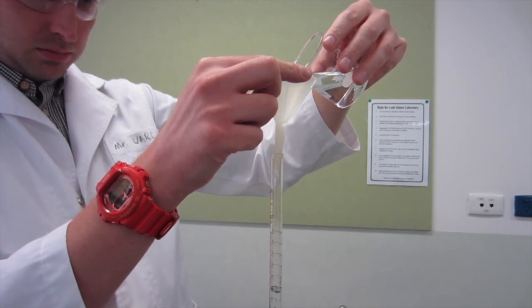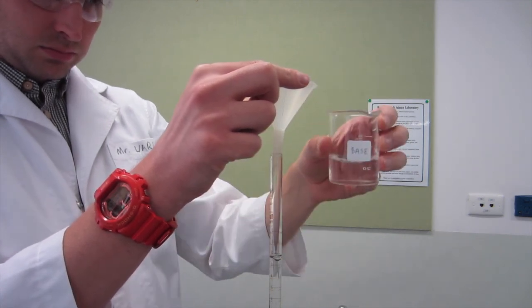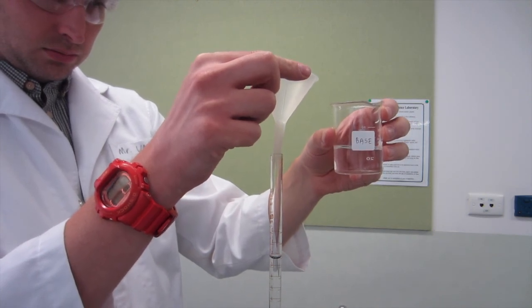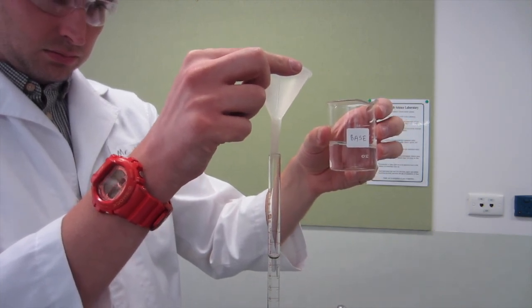You don't need to get to zero, that's not necessary. Once you've added, you shake your funnel a little bit to get rid of any final drips. Then you place the funnel in your beaker.